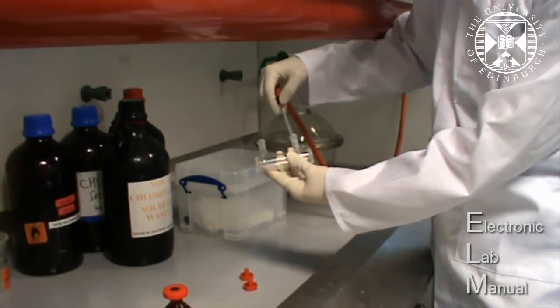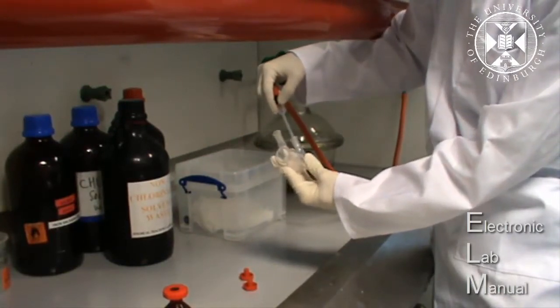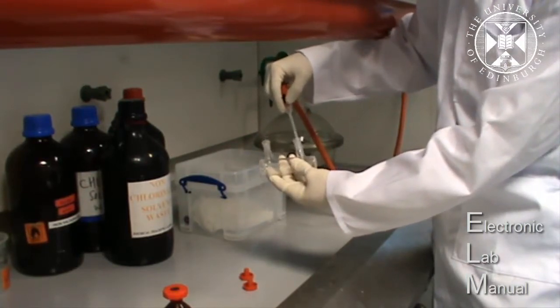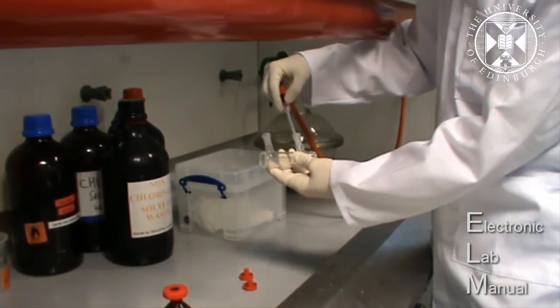Also be careful when you're holding the glass cell not to touch the circular windows at the side of your cell. Otherwise that can ruin the data from the spectrometer.